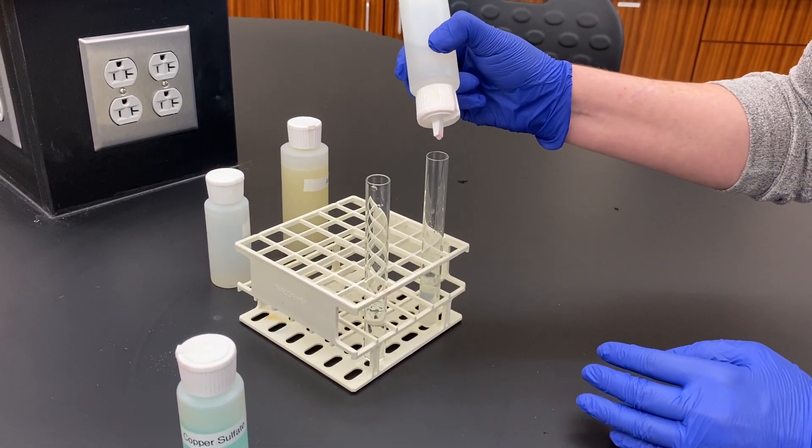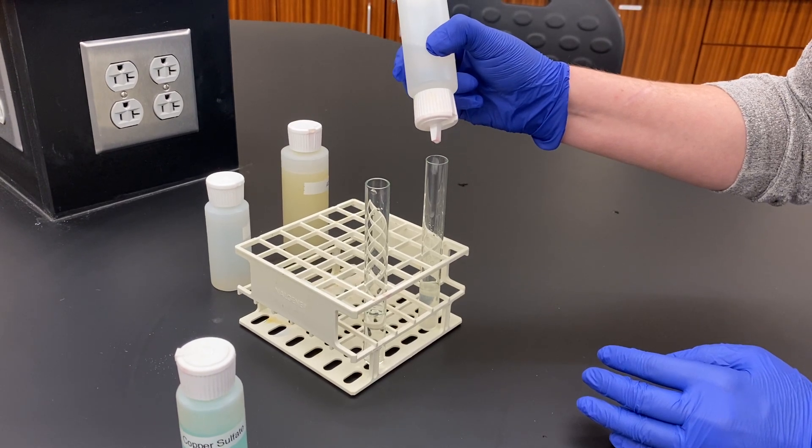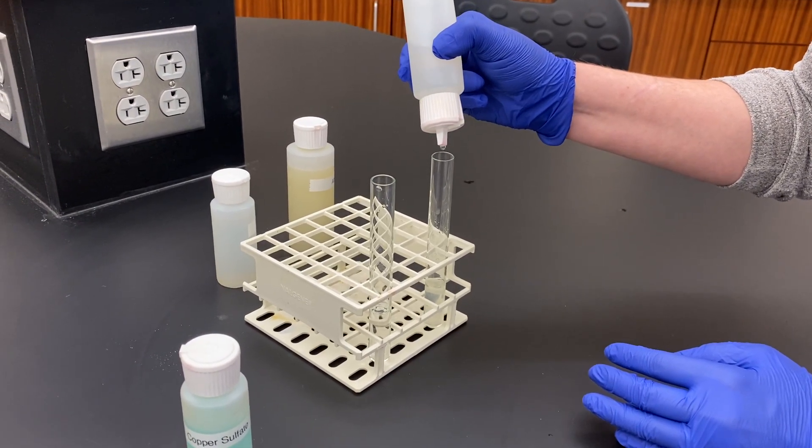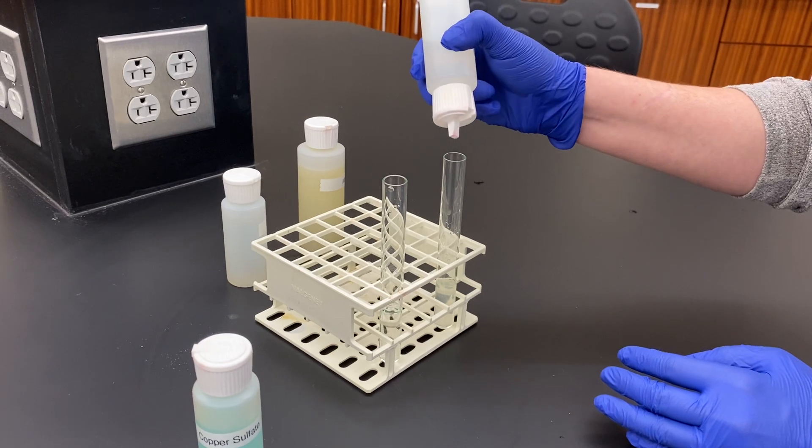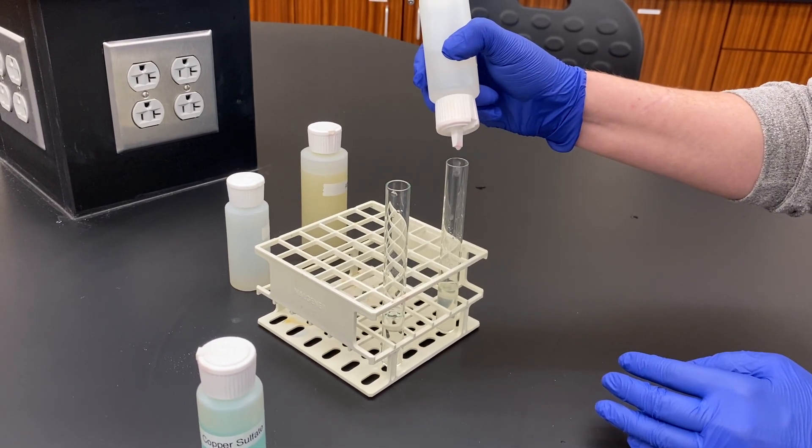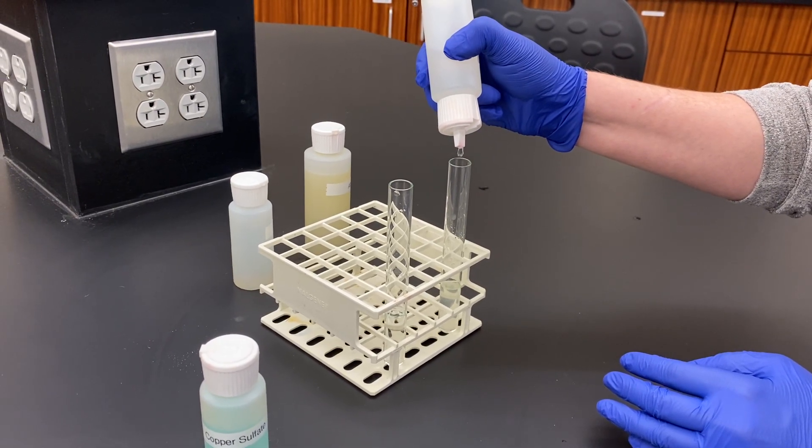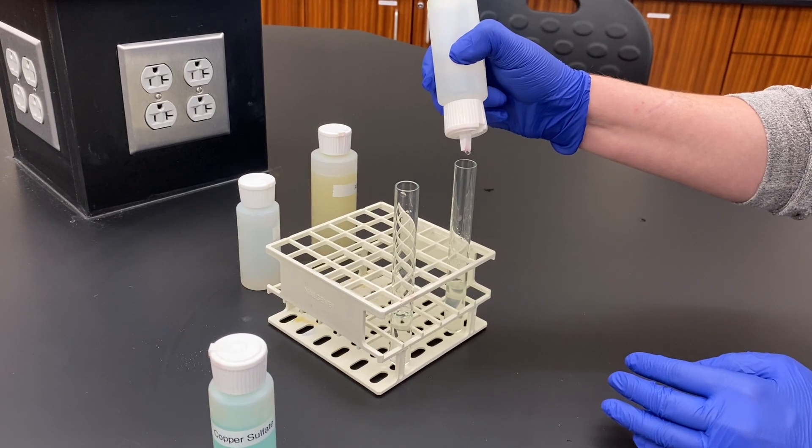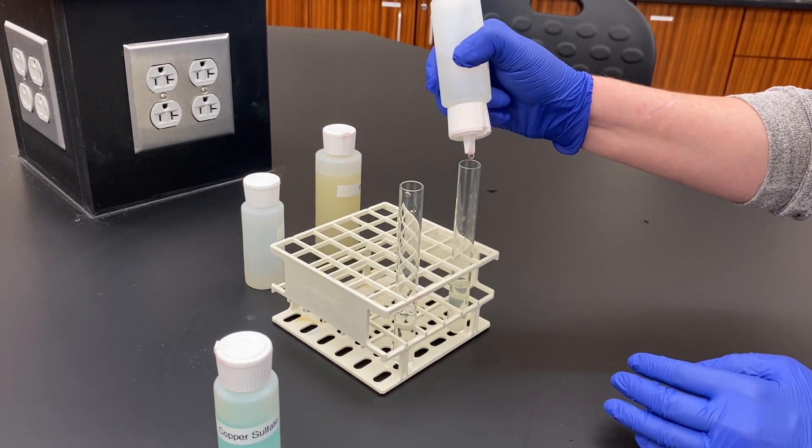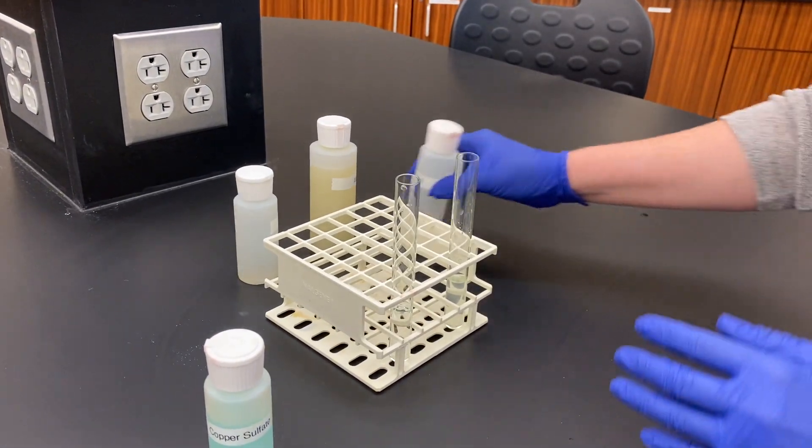1, 2, 3, 4, 5, 6, 7, 8, 9, 10, 11, 12, 13, 14, 15, 16, 17, 18, 19, 20. I'm going to mix this up.